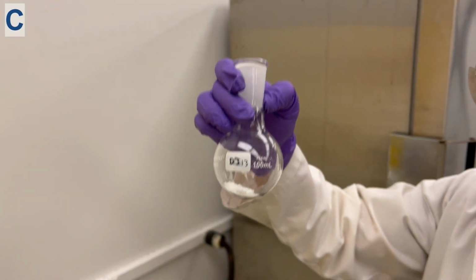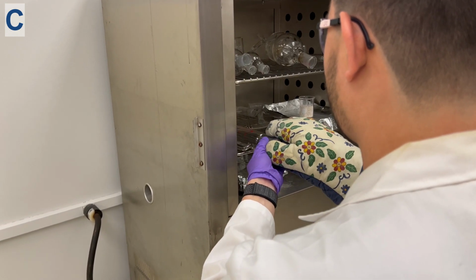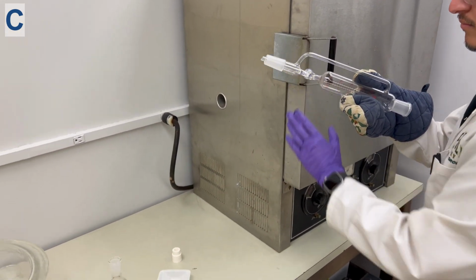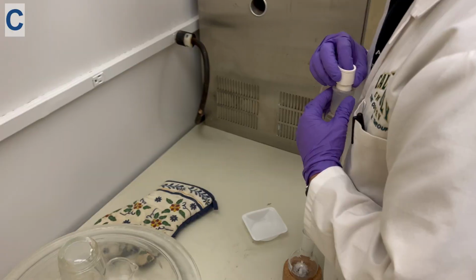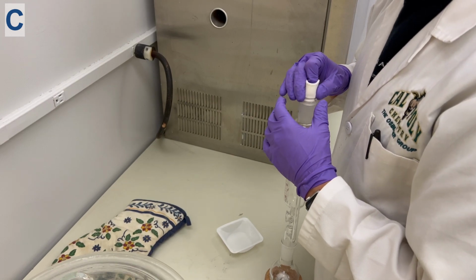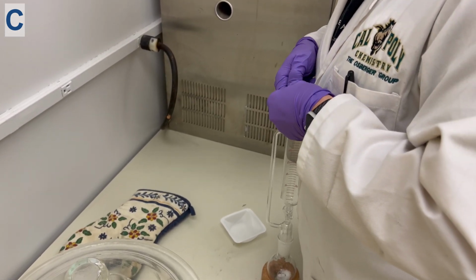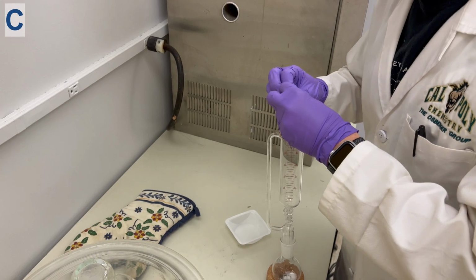Now that the starting material is in the round bottom flask, the addition funnel can be attached to the round bottom flask. Make sure to use oven gloves when handling the hot glassware. Next, close off the system using a rubber septa. Make sure to shove the septa all the way down the opening of the addition funnel and make sure to pull the flaps of the septum over the top, covering the system.